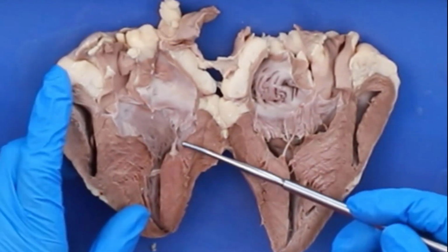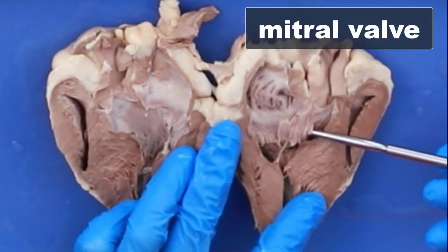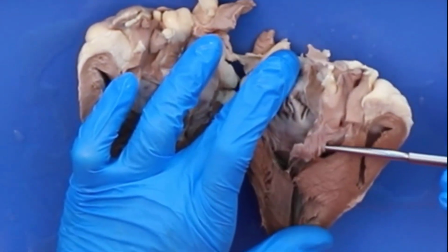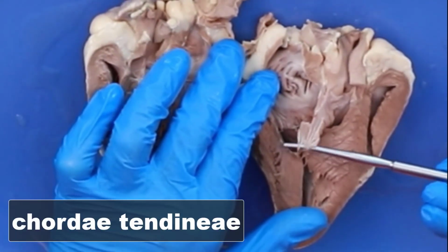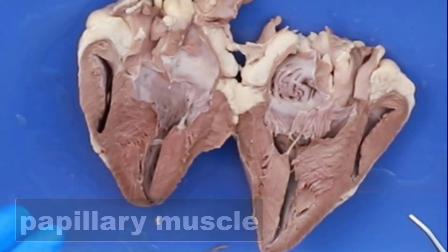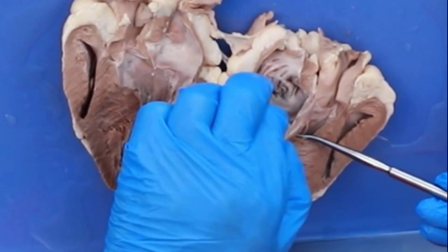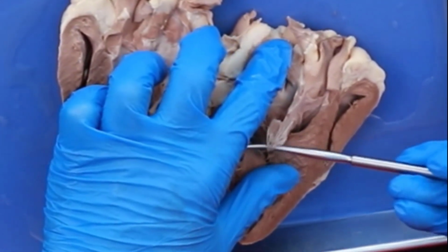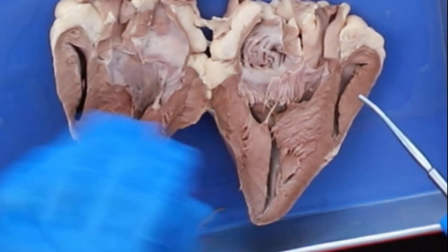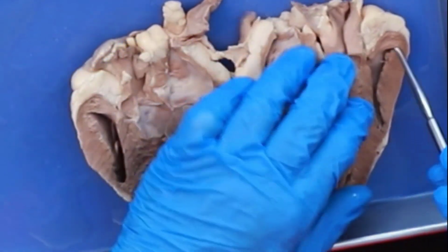So that makes this valve here and here the mitral valve. And because of the look of this, you can actually see the valve here. You can see the chordae tendineae, and you can see the attachment right there at the papillary muscle really nicely. If you're in the lab, you can see the chordae tendineae are really tough. I'm pulling on that, and that's not breaking. Okay? And we have over on our right side, you can start to see some of it.